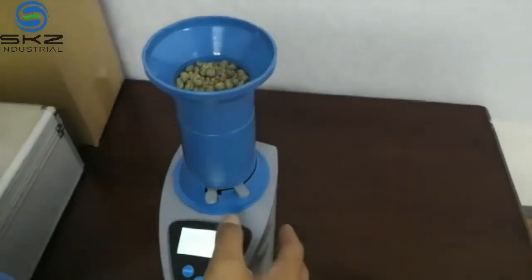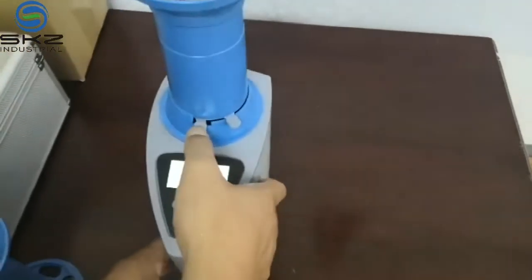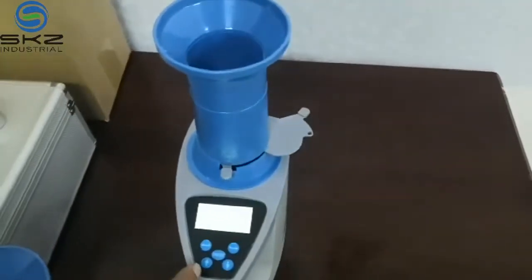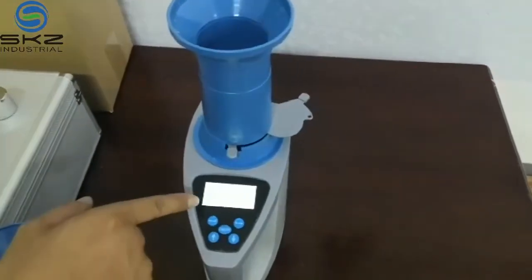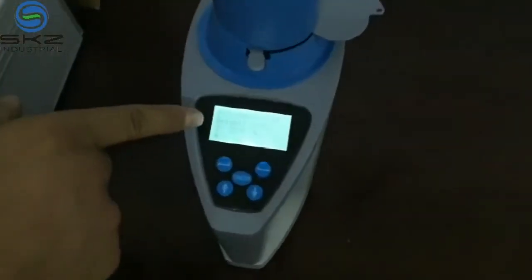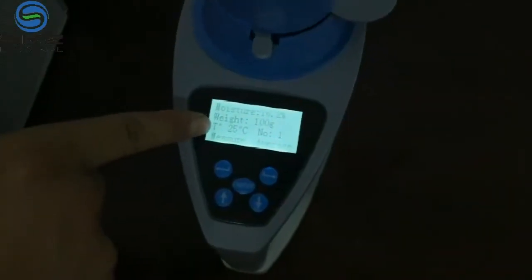Now press this switch. Now it's testing. You see, this is the result: moisture, weight, temperature.